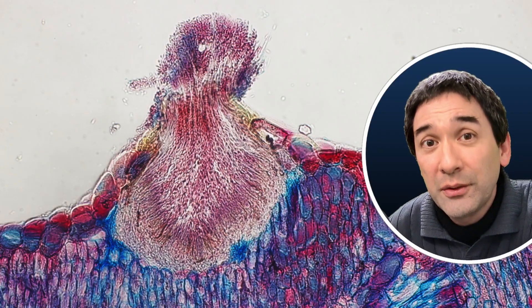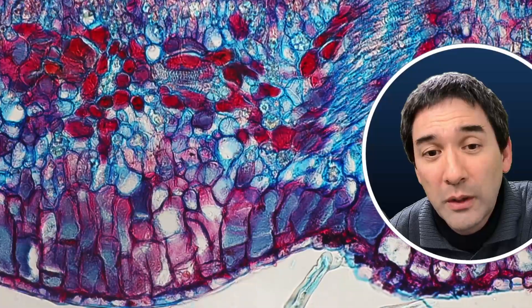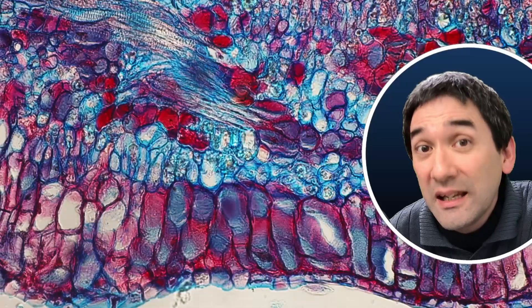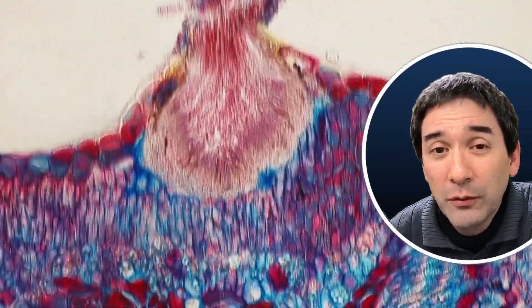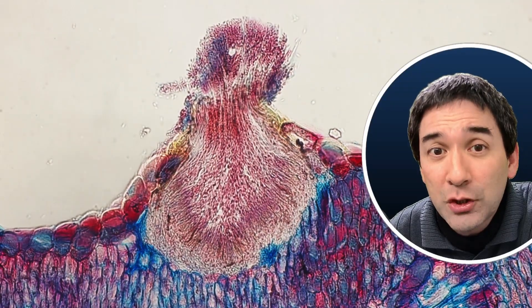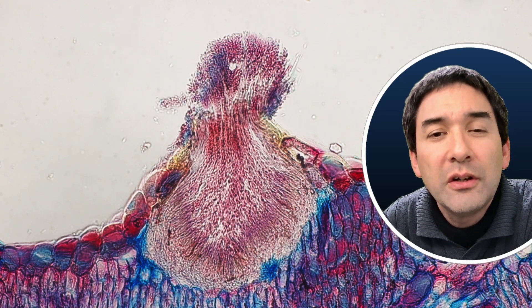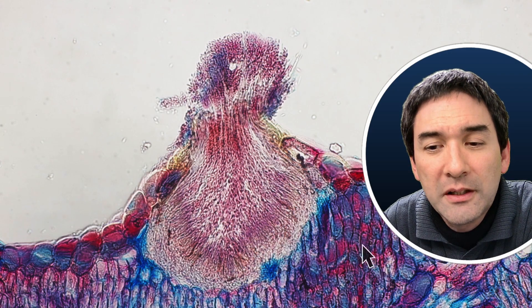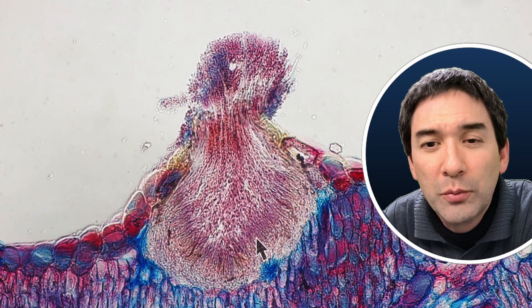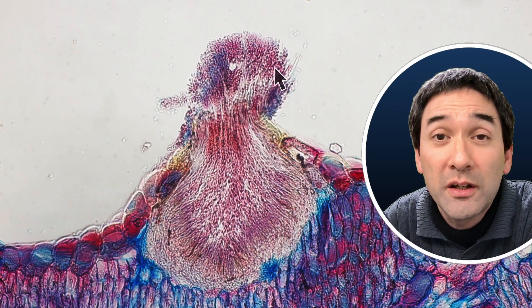What we can also see further down is that the leaf down here seems to be fairly okay. But we see the different types of cells. Of course, it's a stained specimen — a commercially prepared slide. What we have here are basically the structures of the fungus that actually produce the spores. These are probably the spores that are released from the so-called sporangium, which is basically the part that produces the spores.